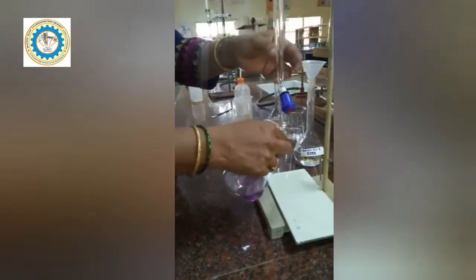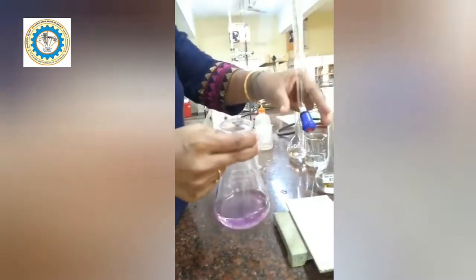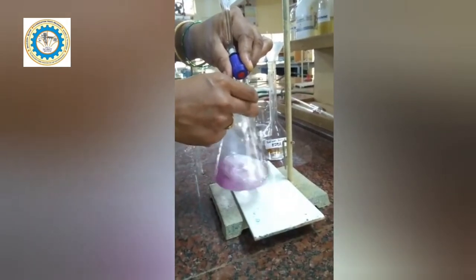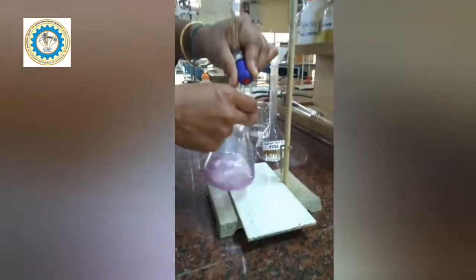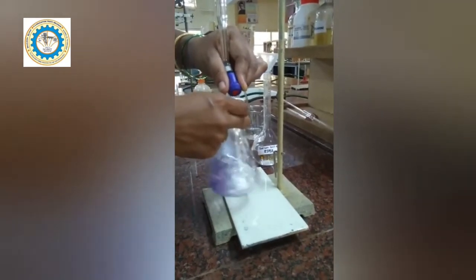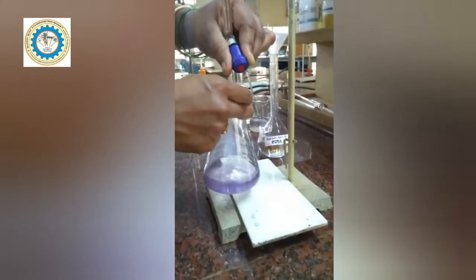Now, I have already taken the EDTA solution into the burette. So now slowly I am going to titrate. I am going to hold the conical flask in my right hand, whereas my left hand — three fingers are going to operate the burette knob. Add slowly. See the color change. Your eye should be just watching the change in the solution color. Slowly add with constant stirring — constant stirring makes the uniform distribution of the solution. You need to be careful at the end point. Add slowly, drop by drop.